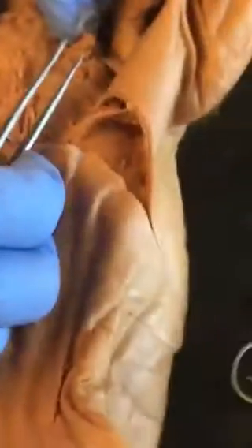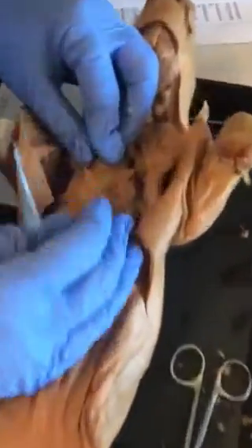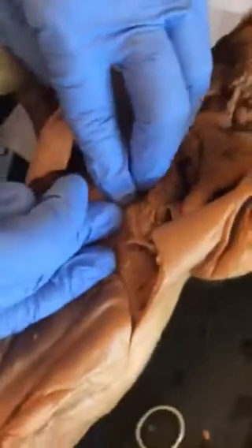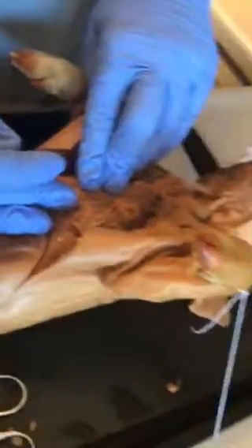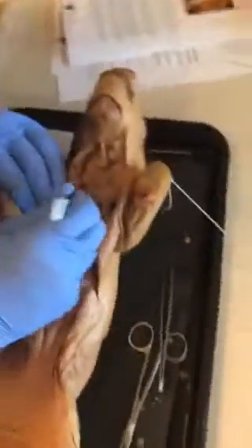Chest muscles. Lift the tissue with the tissue forceps while making a diagonal cut to ensure you do not damage any underlying structures such as the diaphragm. The rib cage can be difficult to open once you have made the correct cuts. In addition, bone fragments may be sharp. Make multiple cuts between the ribs. Okay, so we're gonna go ahead and go past the ribs then.